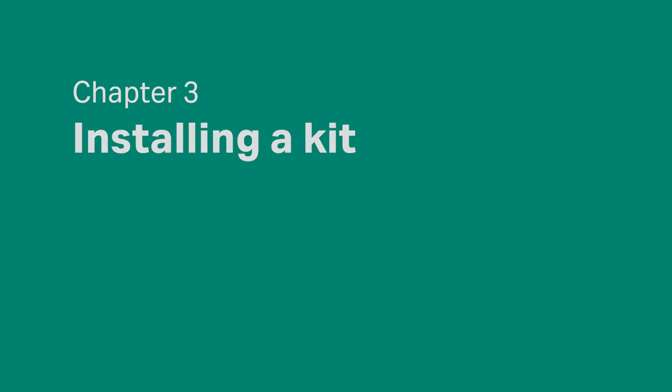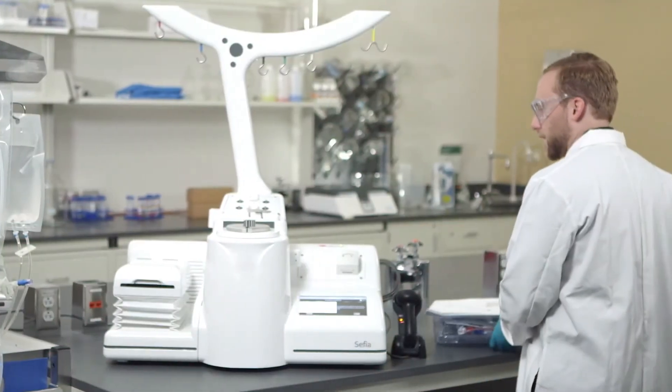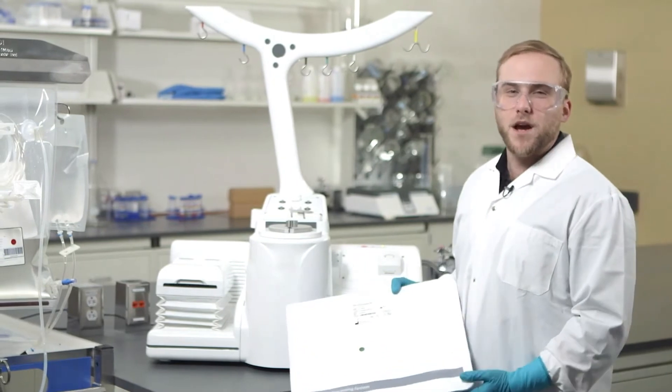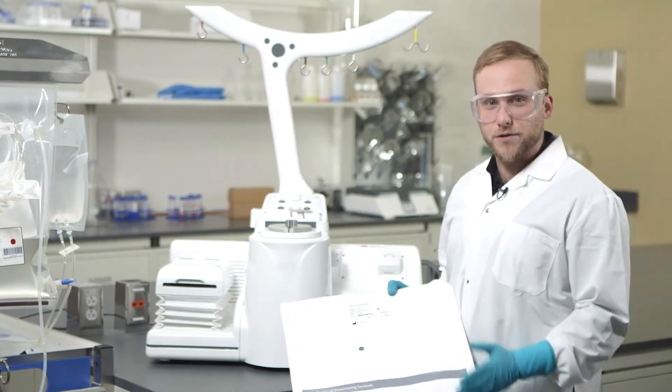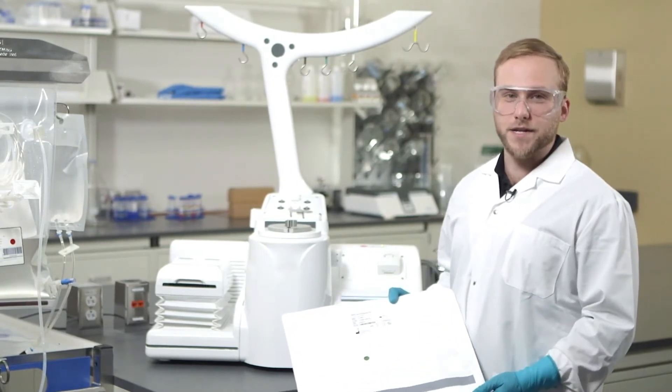To install a kit, take the blister pack, verify the kit model and information on the label. Also, be sure that the sterility indicator is green and the blister package is not damaged.